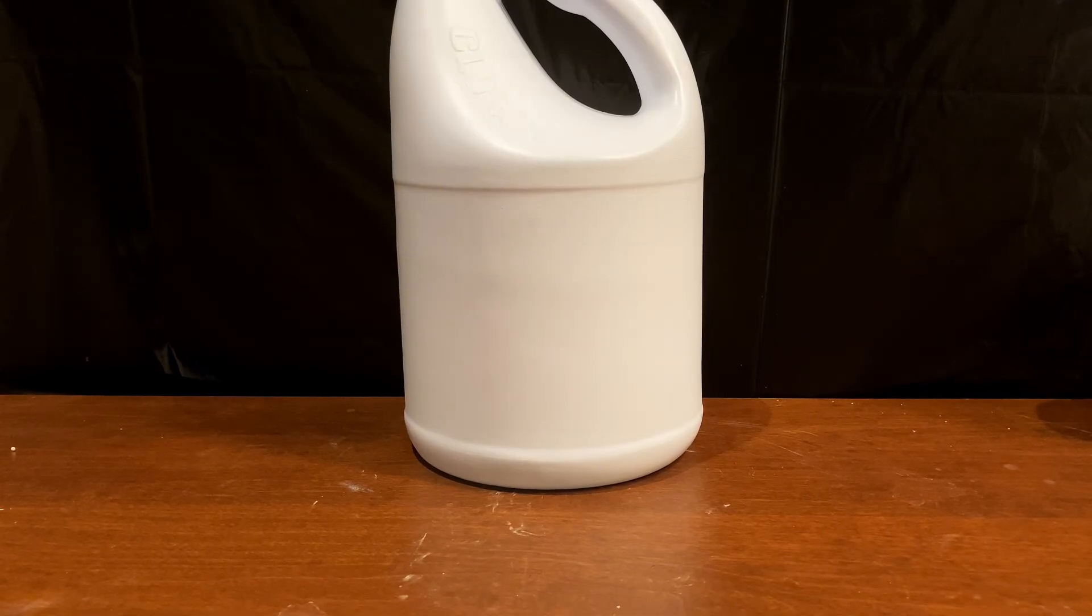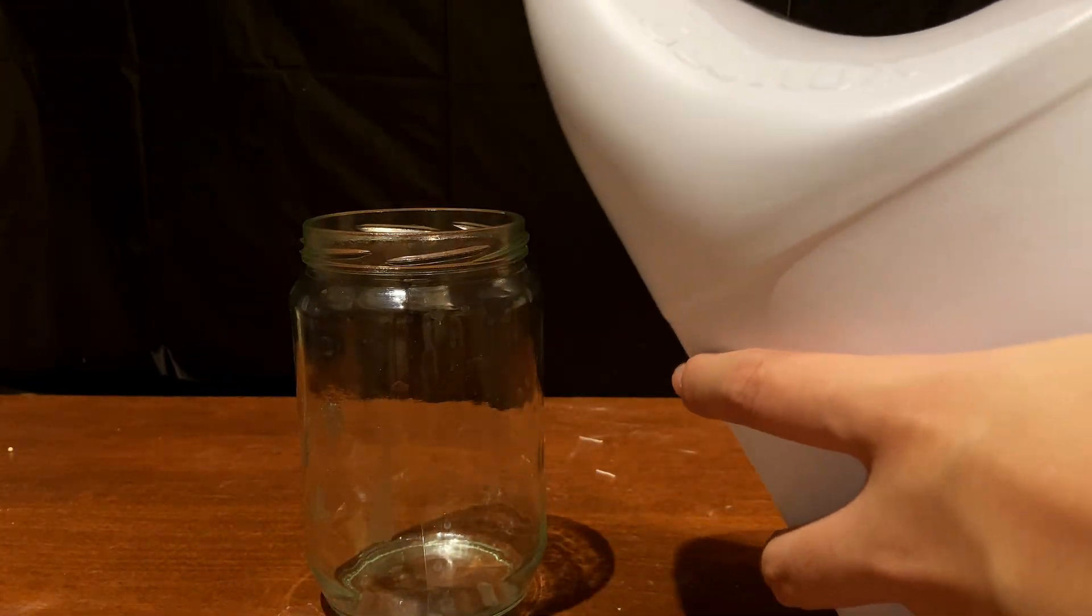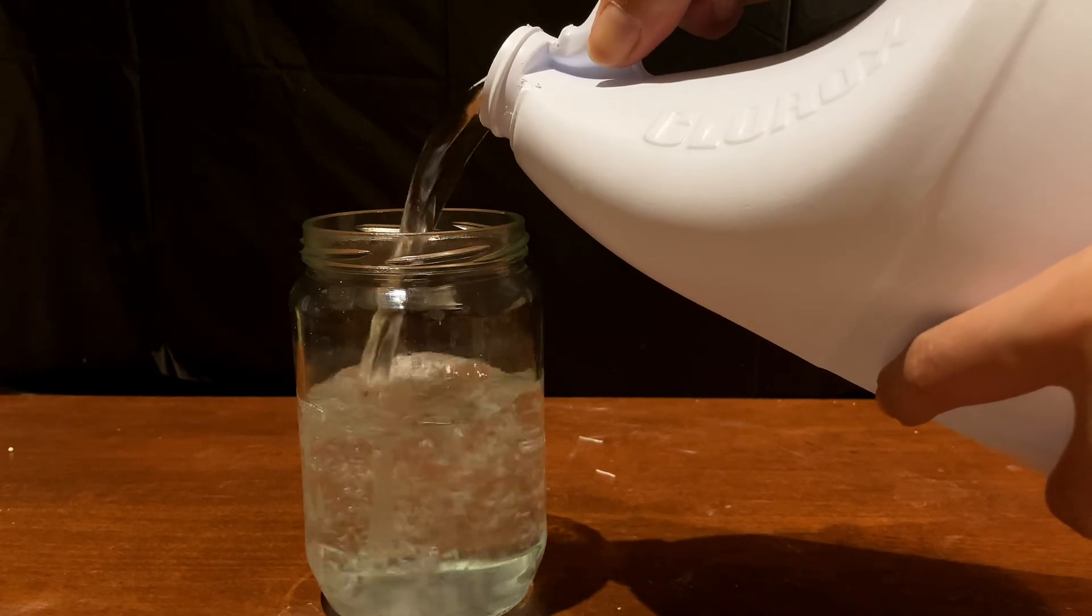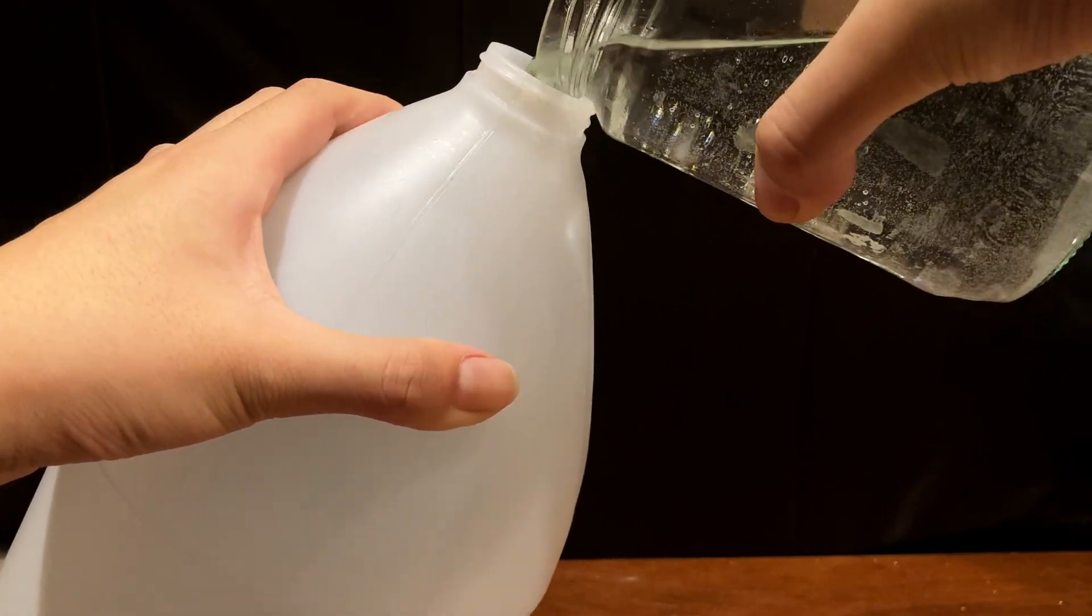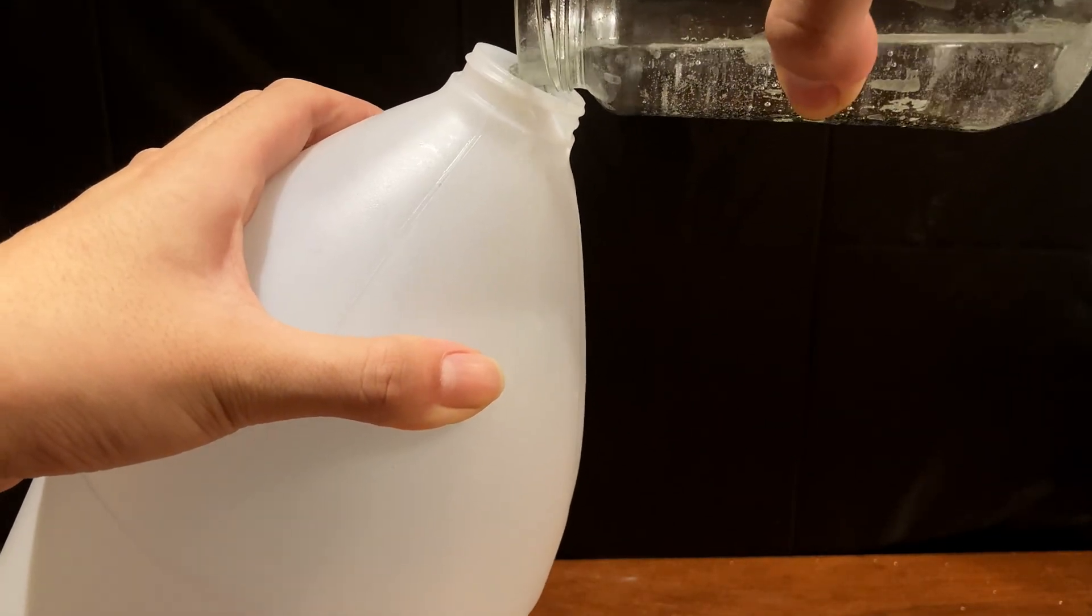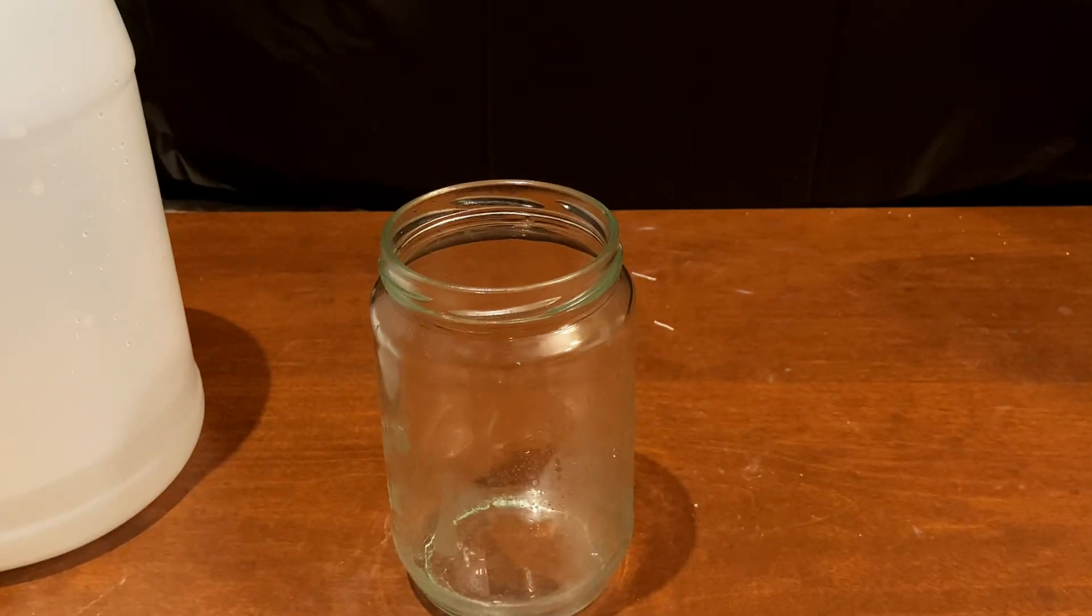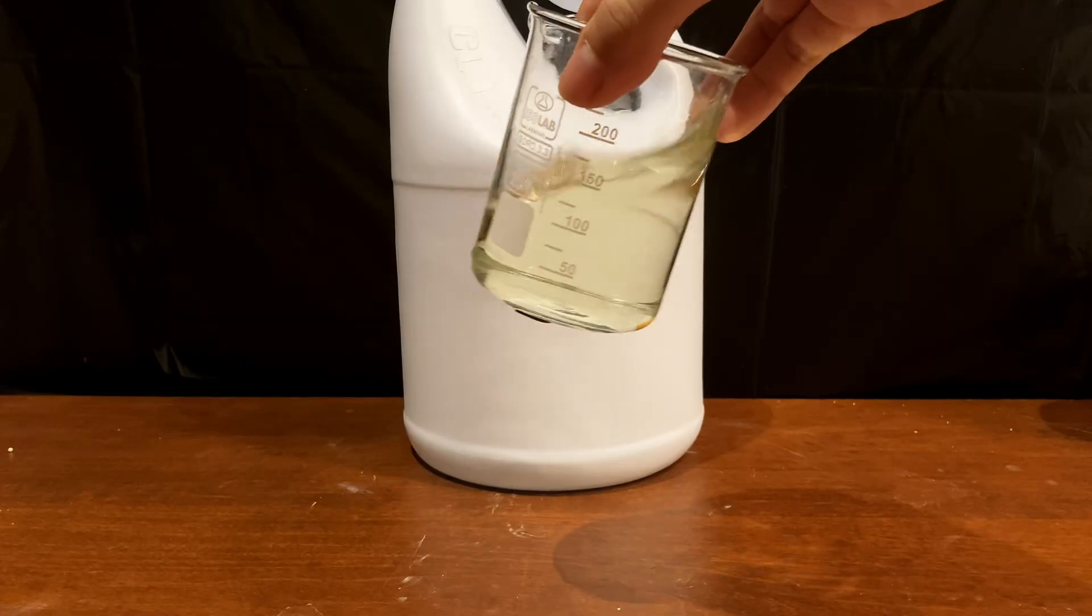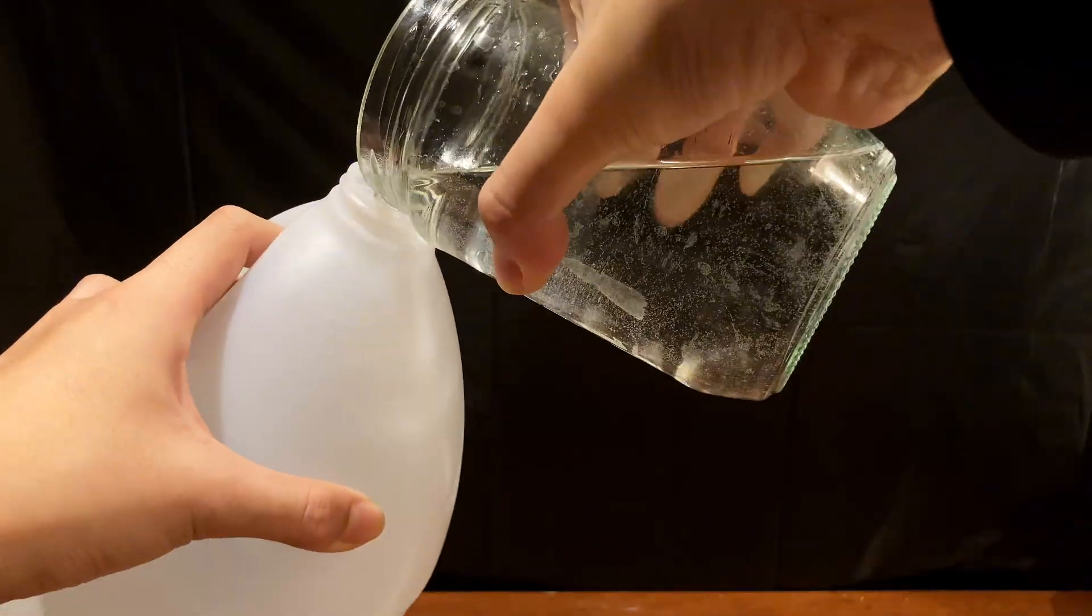The next day, I got the two bottles of bleach which should theoretically have some chloroform at the bottom. I was a little unsure because the cans were opaque, and I had no idea if the reaction had actually worked. Now since most of the bleach solution was water, and only a few mils of chloroform settled, I'm going to have to decant off the vast majority of the liquid above, and the chloroform will only be left at the bottom in the end. So after pouring out some of the top portion, I was reassured that it probably worked, as the bleach had almost lost all of its green color as seen previously. It took a while for all the water to be removed, and it was only in the last two pours where the chloroform started coming out.